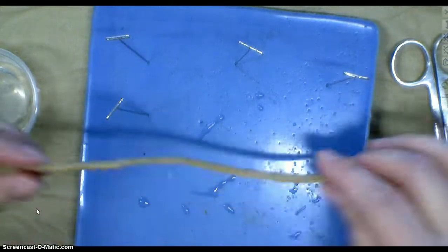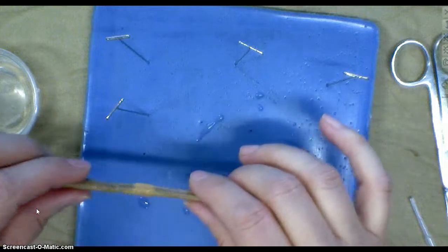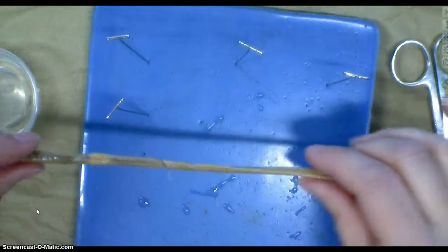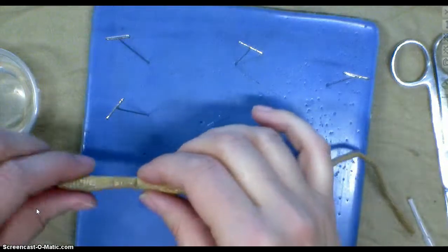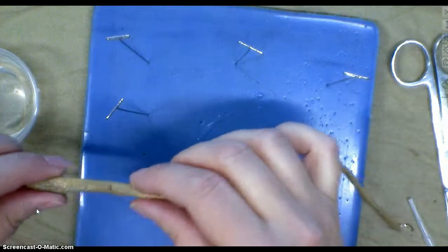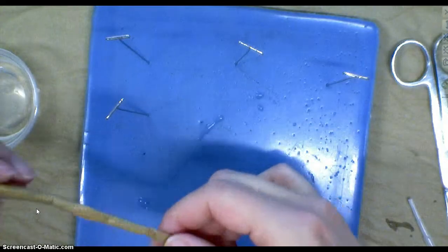The reason I am handling it is so that I can tell which side was the side it crawled with and which side was not. Because you can feel the little bristles that they use, kind of like track spikes, only not that sharp, just to grab the soil while they were moving through.